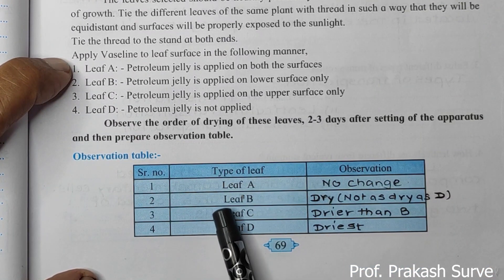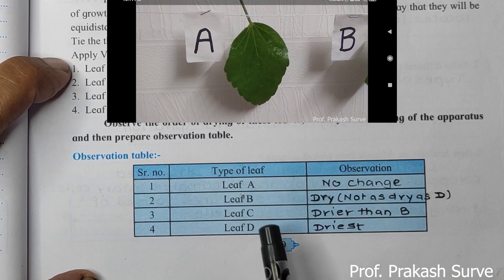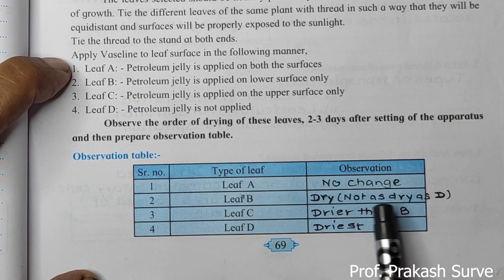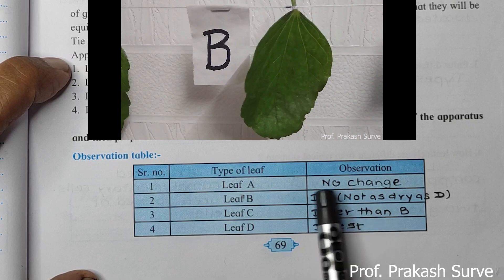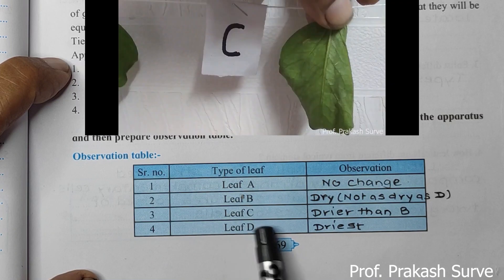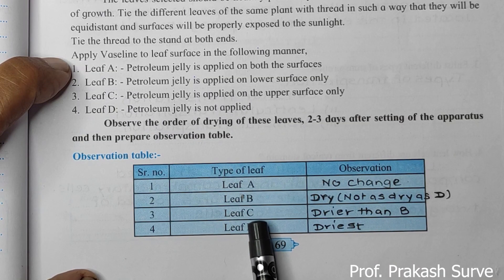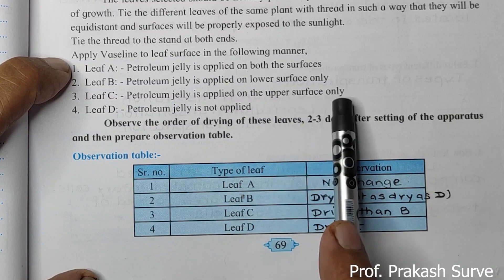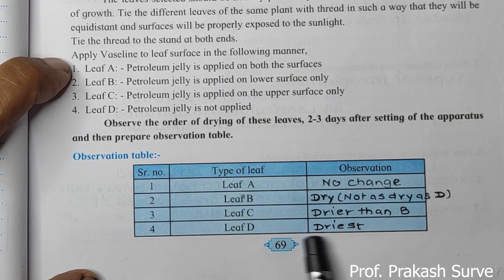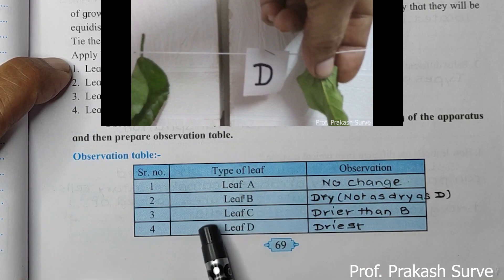You have to fill up the results table. Leaf A shows no change because petroleum jelly is applied on both sides, so no stomatas are open and there is no transpiration. Leaf B is a little dry but not as dry as Leaf D, because petroleum jelly is applied only on the lower surface. Leaf C is drier than Leaf B because the maximum stomatas are open — jelly is only on the upper surface while the lower surface stomatas are all open. Leaf D is the driest one as no jelly is applied, so all stomatas are open.